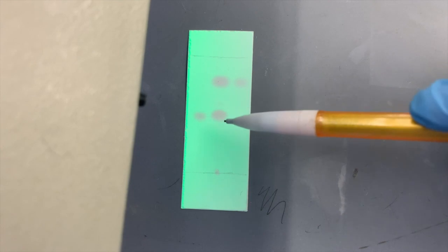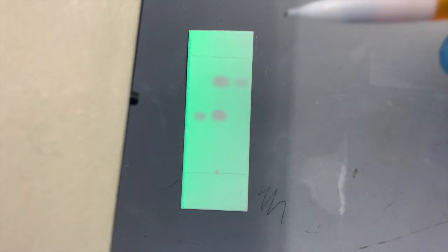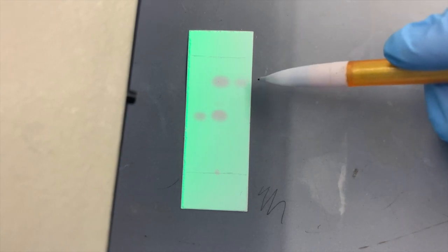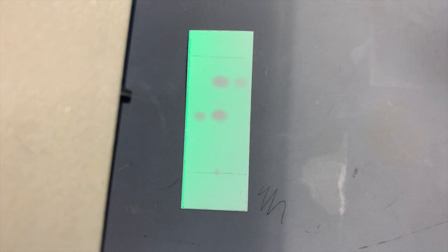So I want you to answer 2 questions. 1, was the reaction completed after an hour? Second question, is our product pure? The product that we obtained by vacuum filtration, is it pure? Did you think about it? If you're not done thinking, pause the video and think about it. Okay, I'm assuming you paused the video.